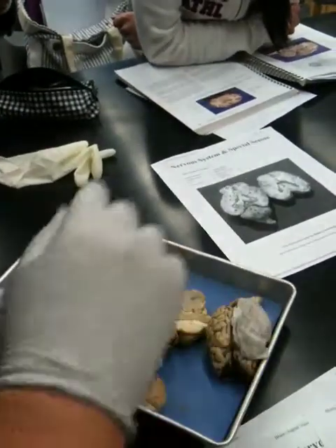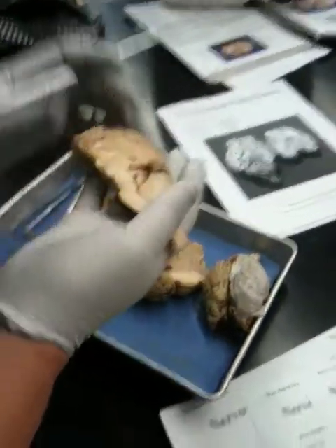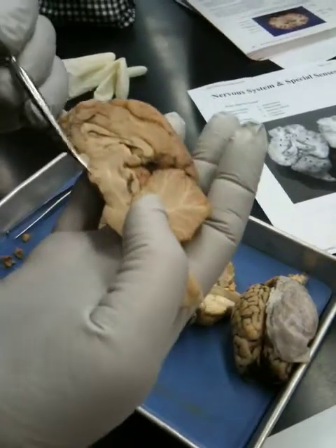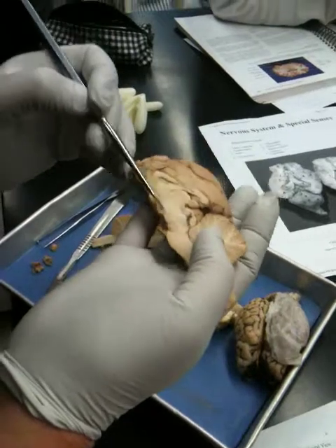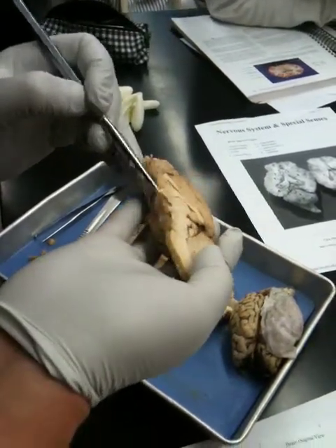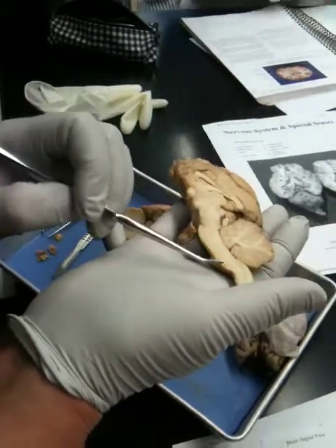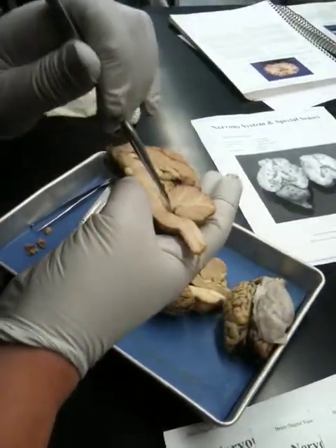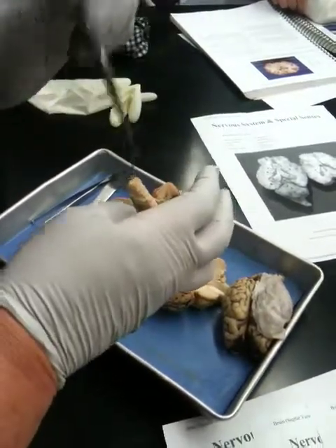What's the mnemonic? When I get to the cranial nerves, I'll give it to you guys. Here you have it again: the pineal body, the optic chiasma, the thalamus, the hypothalamus, the infundibulum to the pituitary gland that's gone. One bump — pons; two — medulla. Fourth ventricle, cerebral aqueduct, central canal, spinal cord.